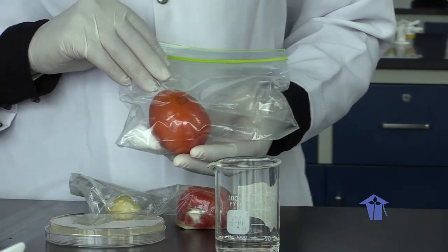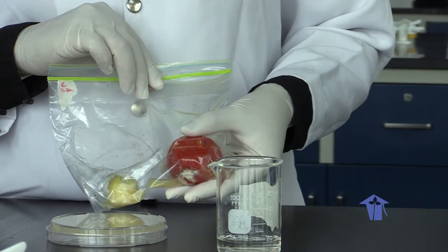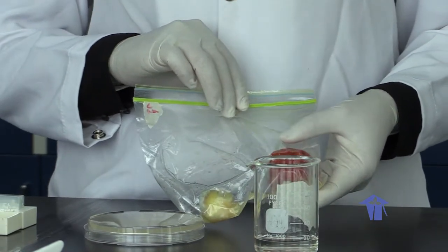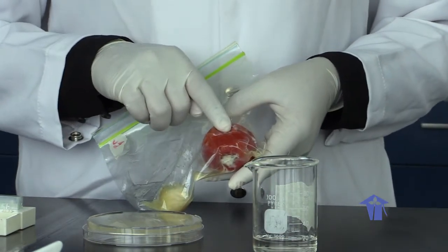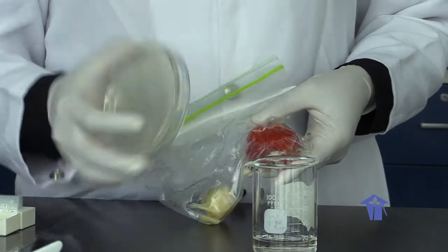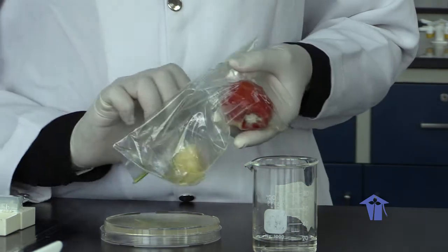So for this session, what we would have to do is observe our diseased tomato, look at the signs and symptoms. You will look at things like the lesions, the discoloration of tissue, and so on, and compare it to our first sample to see whether or not the signs and symptoms were the same. Additionally, at a microbiological level, we are going to inoculate this sample onto a nutrient agar, allow it to incubate for 24 to 48 hours, and then we will be looking at the colony morphology. We'll carry out a gram stain on that organism and look at colony morphology to compare that to our results from our previous colonies that we would have obtained from this organism.